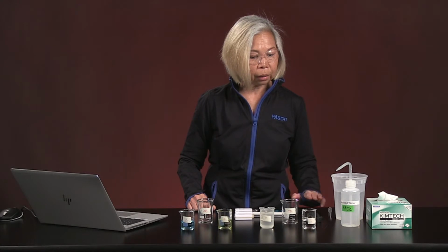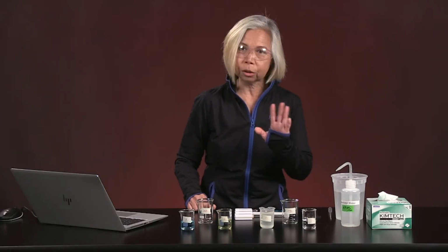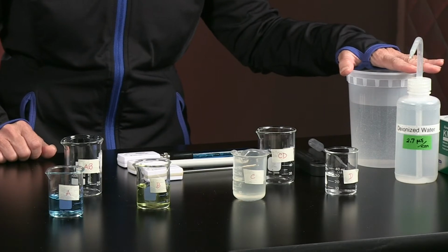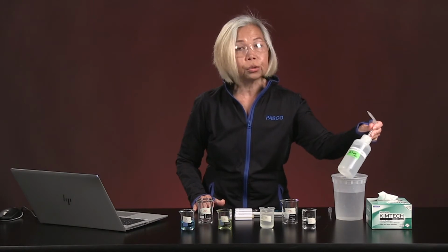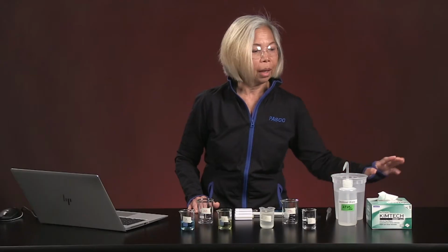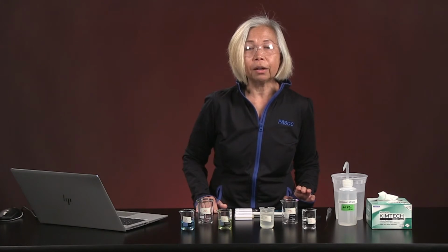We also have, and this is something that I find very handy, a little holder so that I can put 2 sensors into one little bracket just to make things a little bit easier for me. I love having a large tub of distilled water as my wash bucket, especially in labs where we're using 3 different sensors. Or you can choose to use your typical wash bottle. I will show you why I have this little dropper with me. And of course, it's always handy dandy to have a little box of Kim wipes with you. These are all of the materials we're going to be needing for today's lab.